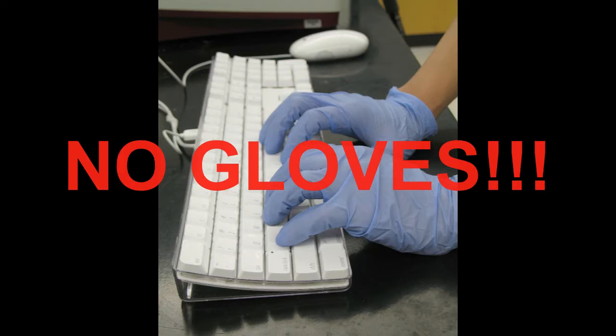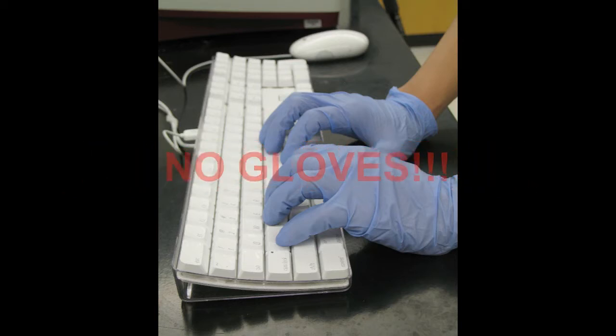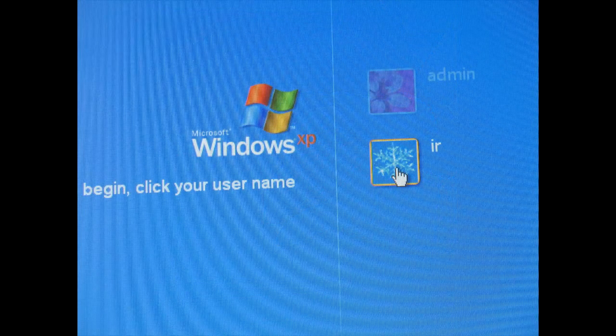or hazardous waste. And so if you put it on the keyboard and then someone else goes to use the keyboard and is not wearing gloves, you're going to be exposing them to those chemicals. So remember, don't ever wear gloves when you're working with the computers in the lab, and don't ever leave the lab while wearing gloves, because we don't want to bring the chemicals on your gloves out into the hallways and the bathrooms at school.